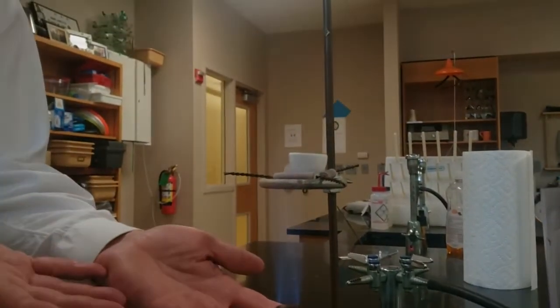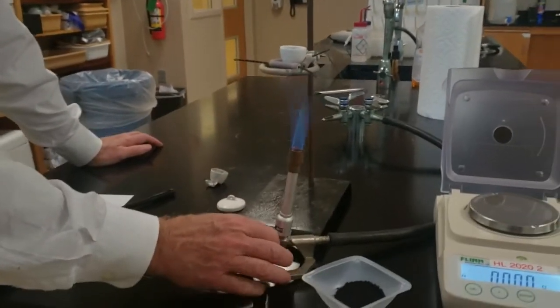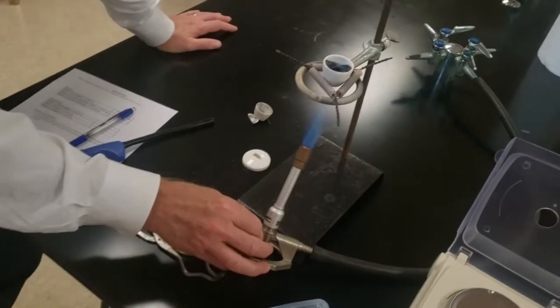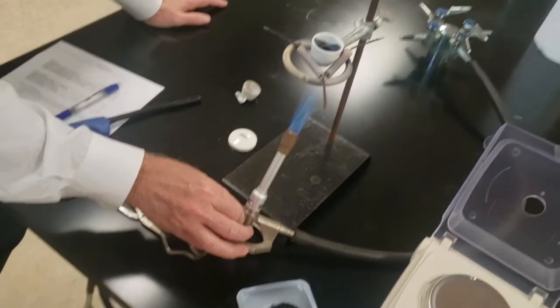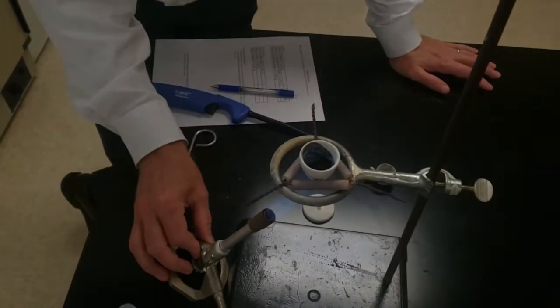You won't want to change the ring stand after you've heated it up. We need a pale blue inner cone. There we go. But we're going to heat this thing slowly at first, so I'm just picking up the base, tilting it sideways and waving it back and forth. I know the thought of holding a burner kind of freaks people out.